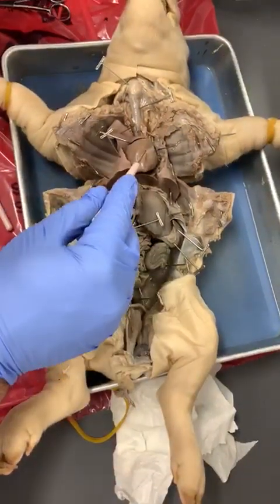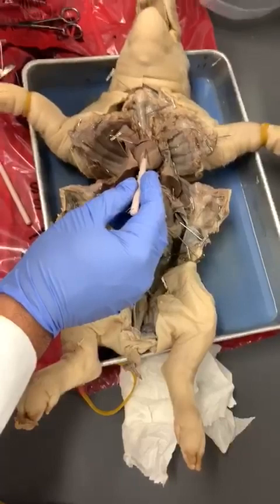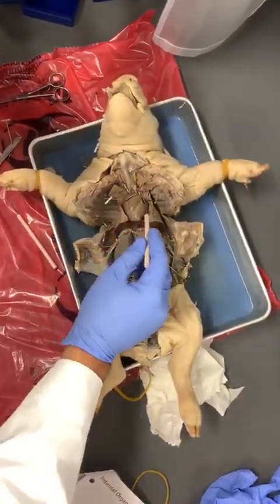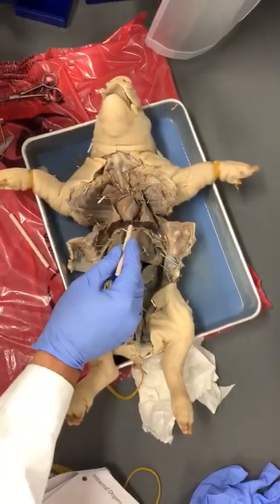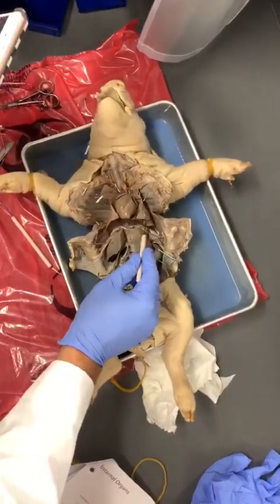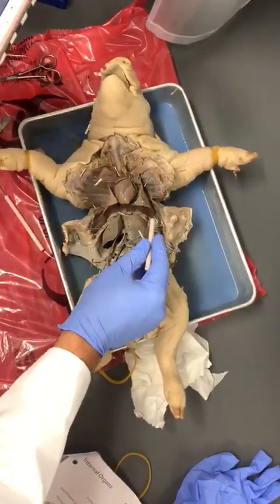And then you have here the heart. So this is going to be the thoracic cavity. On the heart you have the right ventricle. So I guess we're missing a pin here. The right auricle, left auricle, and left ventricle. On the other side we have inferior and superior lobe. So that's the left lung.